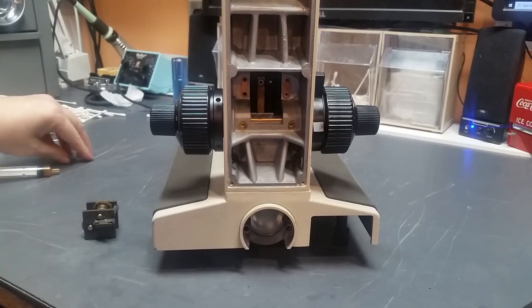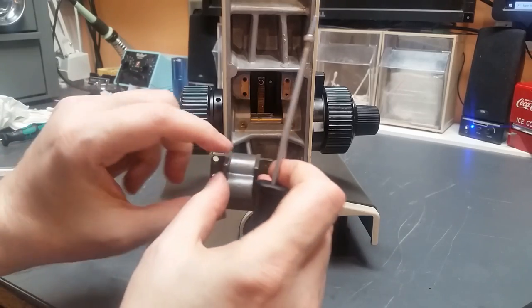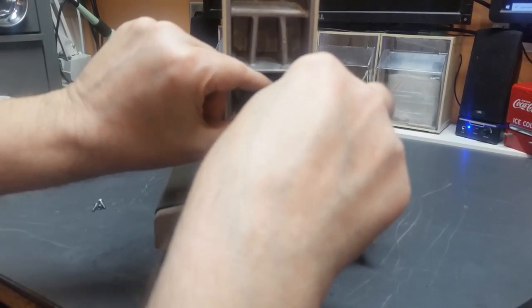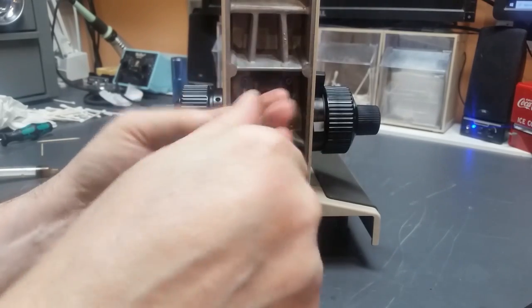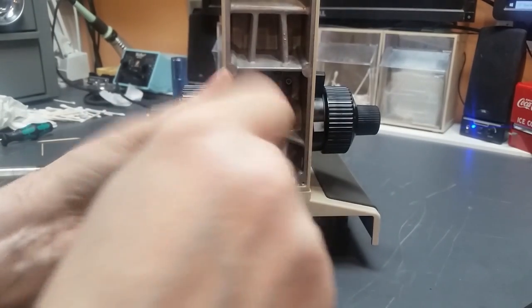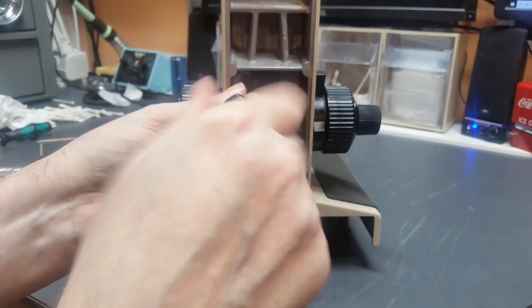So now the gearbox goes in. It's held in place with four screws. Get my 2.5 millimeter tool. And the gearbox goes in like that. And let's try to get her hung in there. Got that one started. There's three. And number four. Okay, now I'm going to basically snug up all these screws and back them up just a little bit so that they're loose but almost snug.